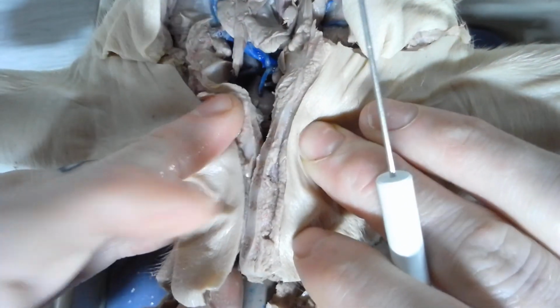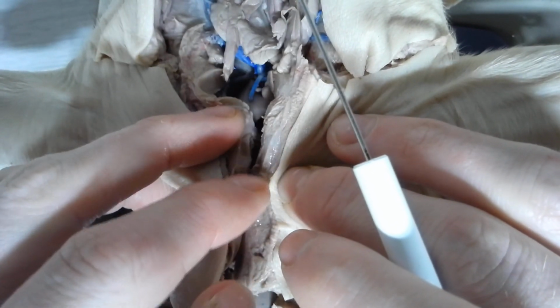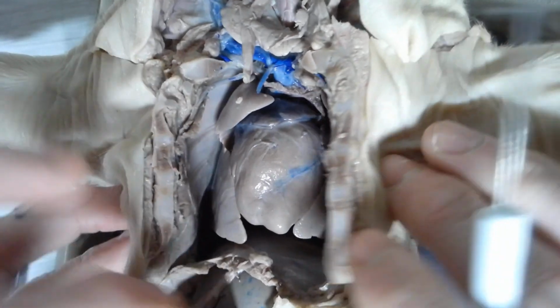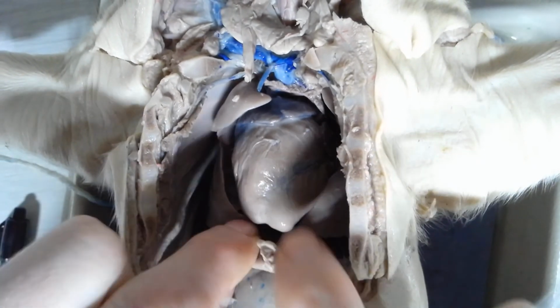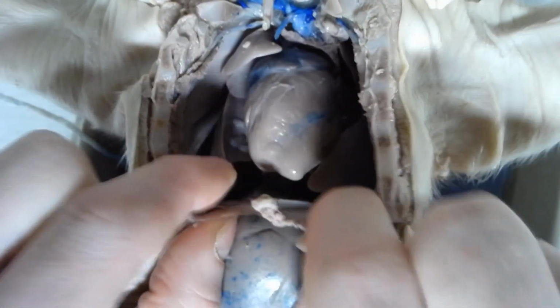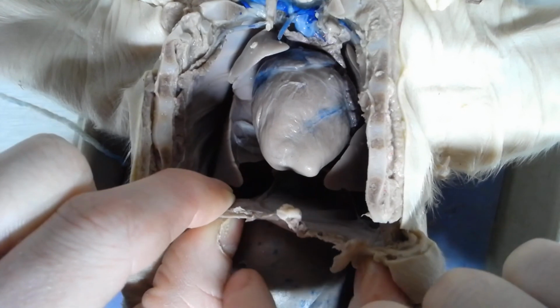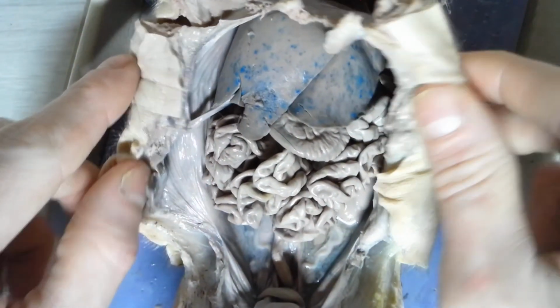And when they come together at the bone, that's called the sternum. I cut through the sternum already so you can see the heart and the lungs. And then the last structure in the chest here, it actually separates the chest from the abdominal cavity. This sheet of muscle that I'm pulling right here is called the diaphragm. It's what separates the chest from the abdominal cavity. So the diaphragm. Okay, moving on down to the lower part of the body, the abdominal part.